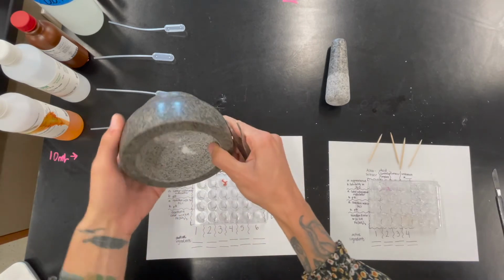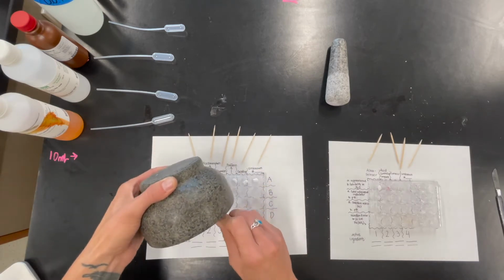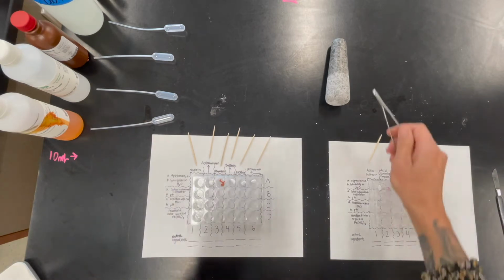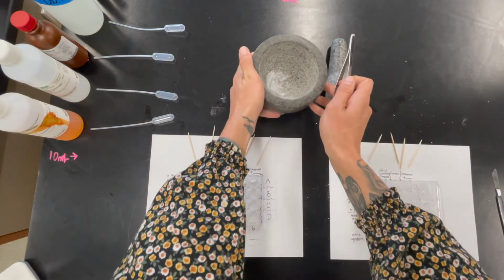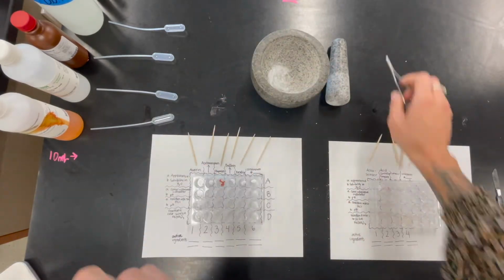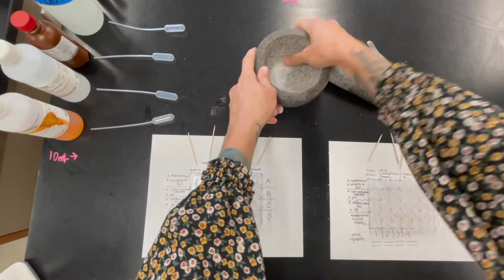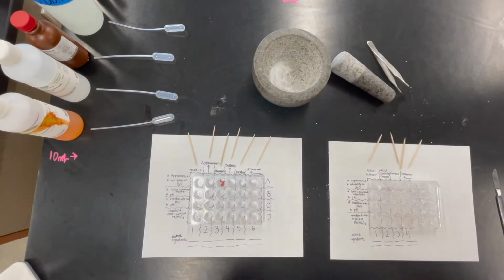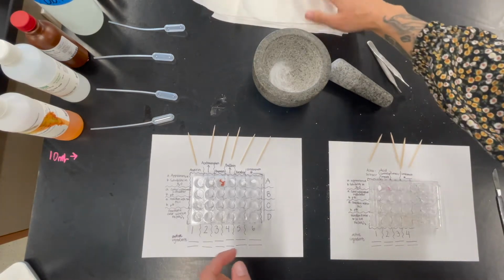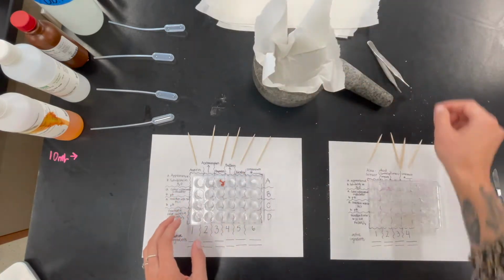It says just a few granules, so that's what we're going to try and do. All right, what I'm seeing happen is the powder is getting stuck in the mortar and the pestle itself. So I'm going to put a paper towel down for each of them so I can shimmy them in. Give me 1 second here. All right, so I have some paper towels here. That'll help me make sure that not all my powder is getting lost to the mortar or the pestle.